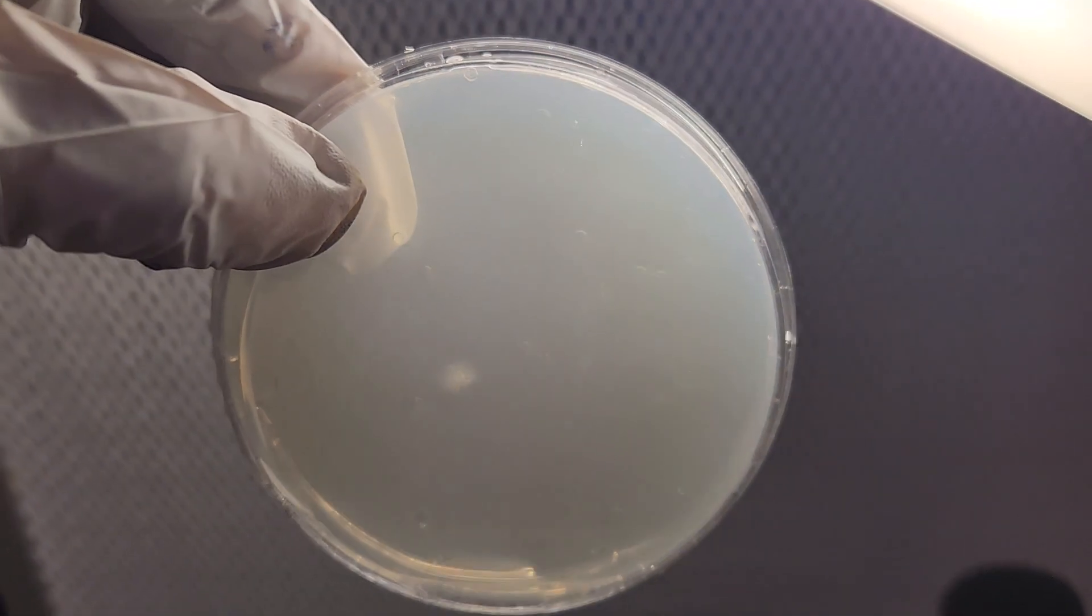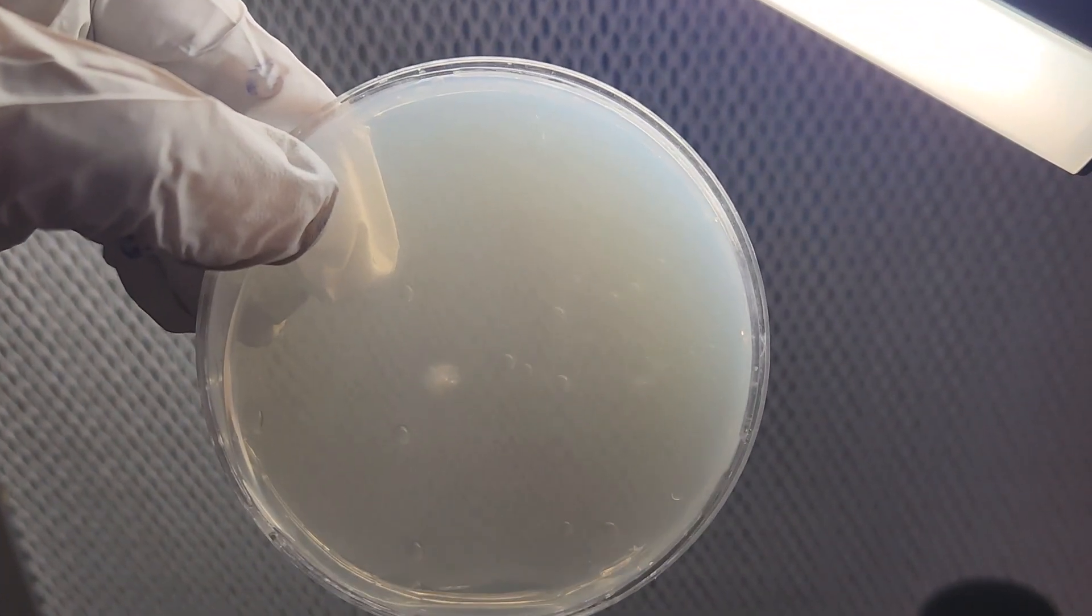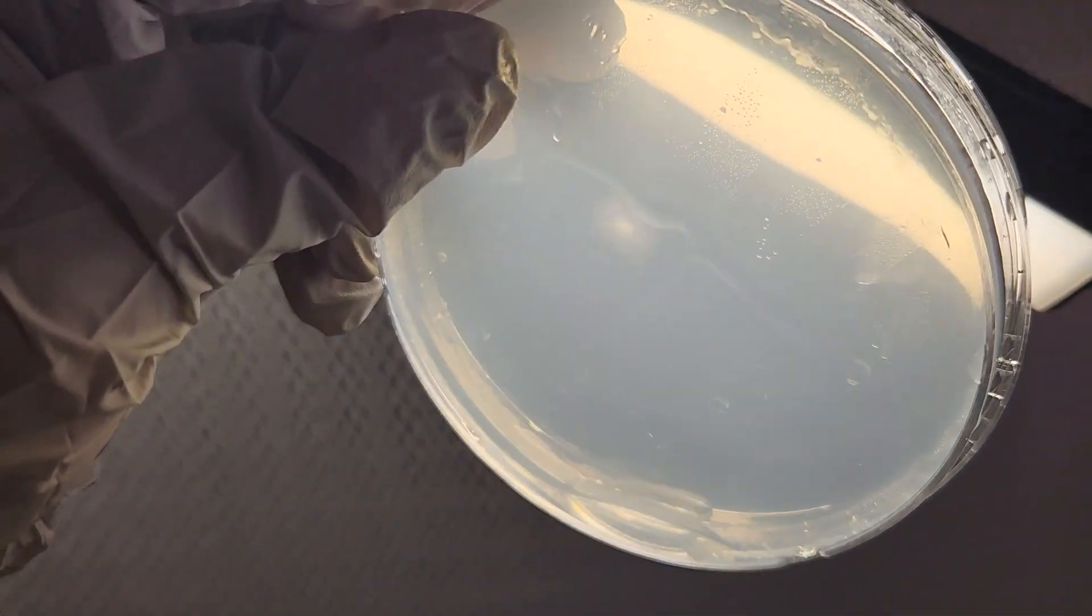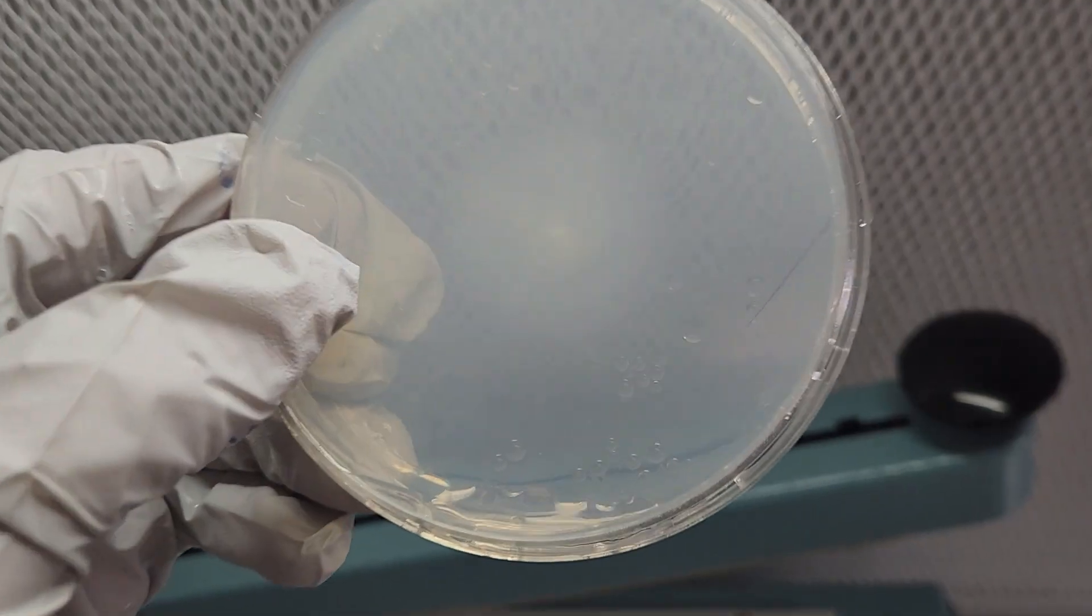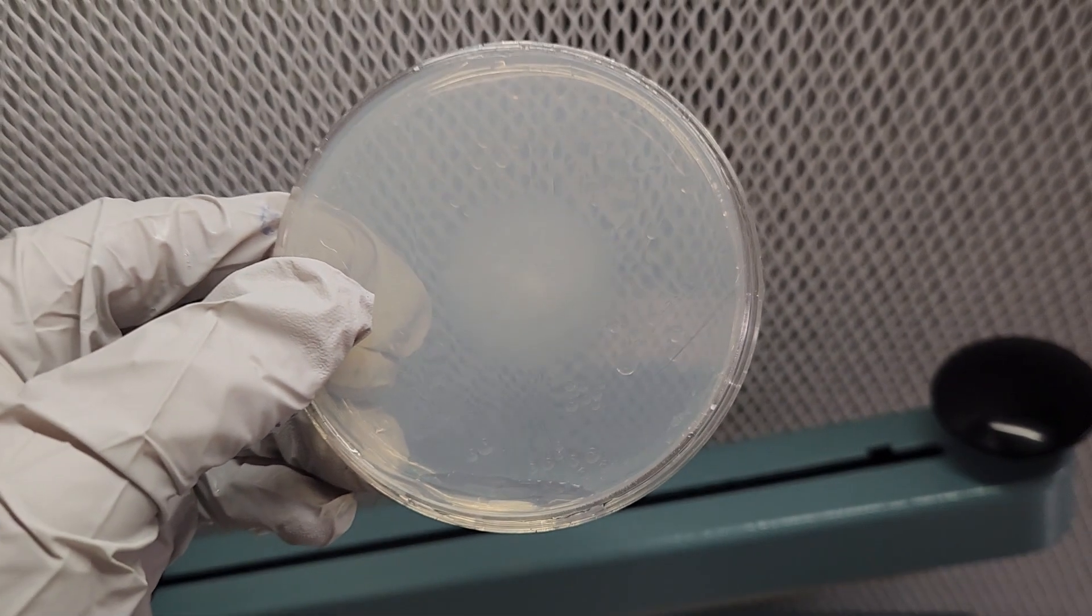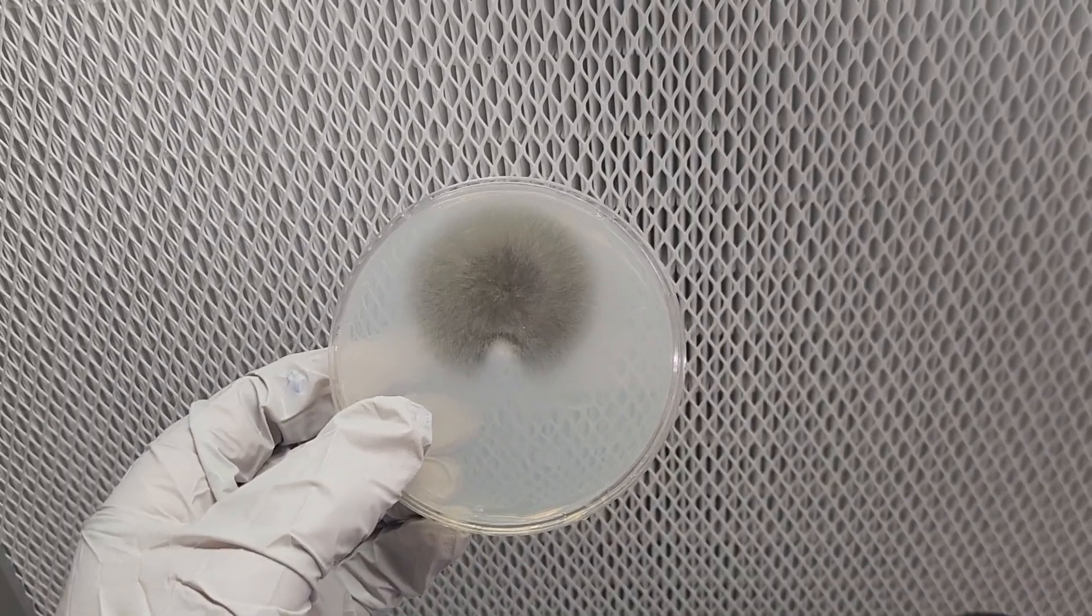Check your plates after a few days to ensure they are not contaminated. You should see germination occur within 7 to 10 days. Some plates may germinate a bit faster or slower. At this point, you will need to check on the plates frequently.